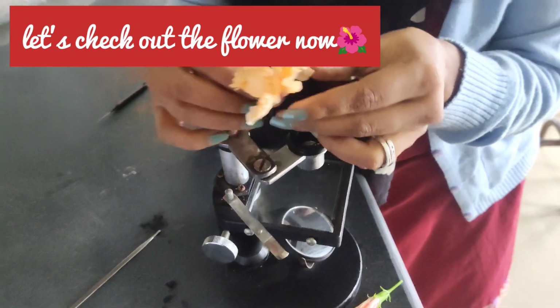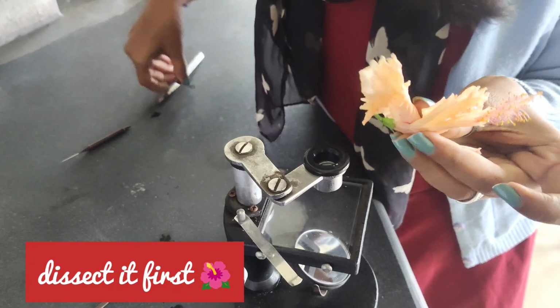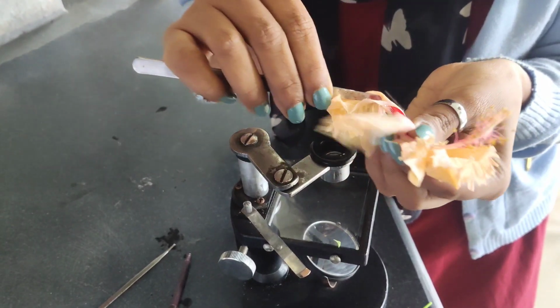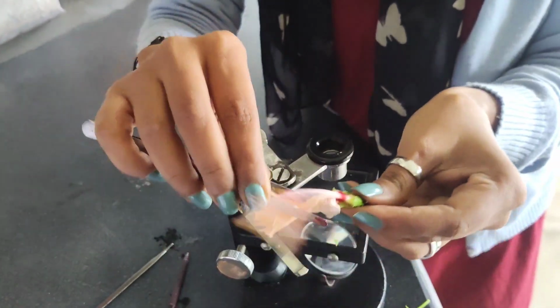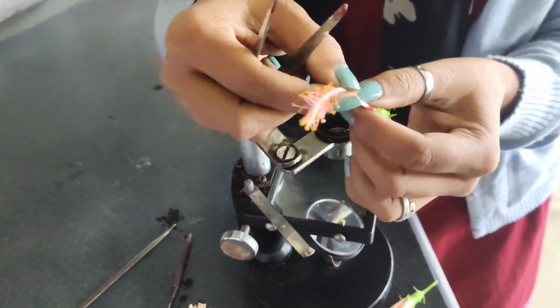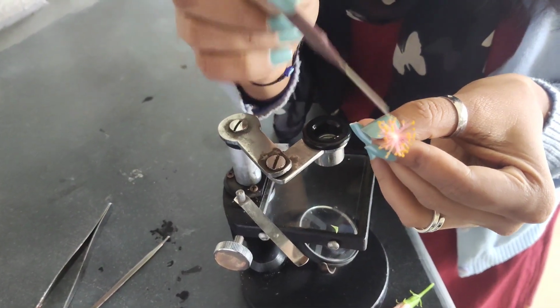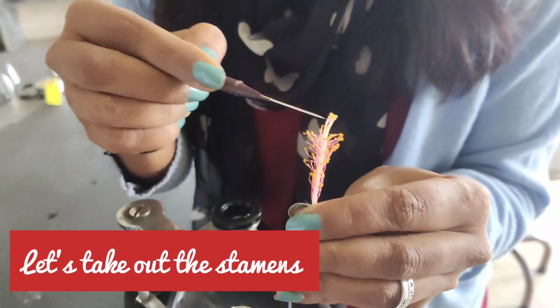While talking about a biology, I'll just show you with the help of a flower that I'm having here today with me. I'm having a hibiscus flower. When I show you the flower, you can see we are having different parts of flower. I'm having some forceps and needles. Yeah, so I'll just remove the sepals and the petals from here. So we are having, this is a bisexual flower that you can see. We are having the stigma, then we are having the style, then we are having the ovary. And here we are having the androecium, that the stamen part is present.